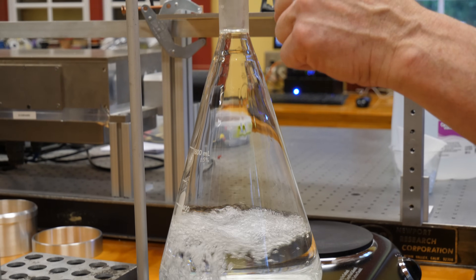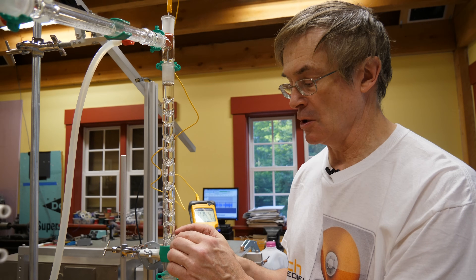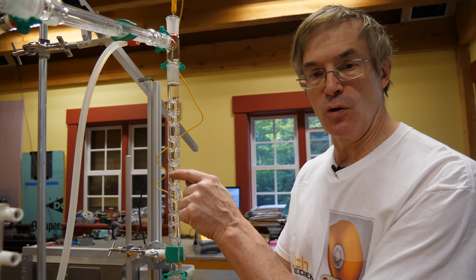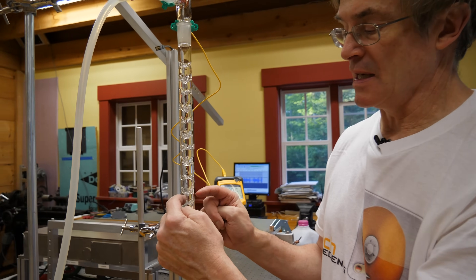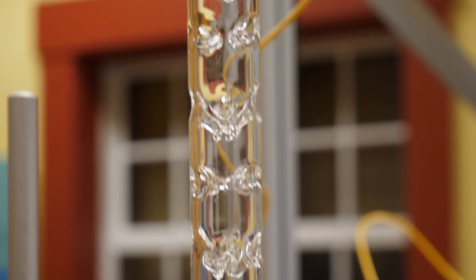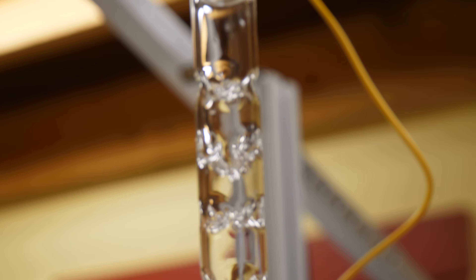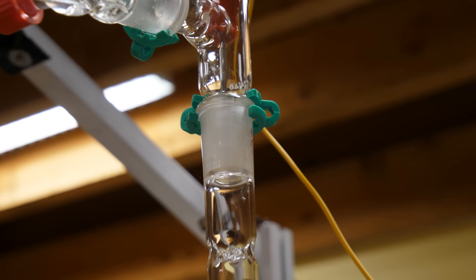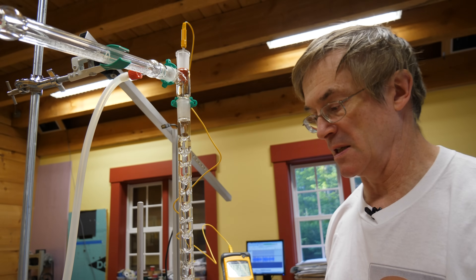Alcohol is always a little ahead of water in this process because it has a higher vapor pressure, so more alcohol molecules can travel higher before condensing and dripping back down. The dimples in this Vigreux column provide additional surface area to improve the number of reflux cycles occurring. Taller columns — even meters tall — give far more surface area for these cycles. But in all cases there's always some water mixed with the alcohol, and always some alcohol left behind with the water.